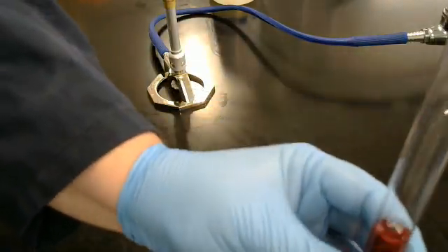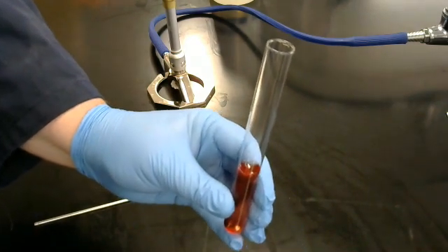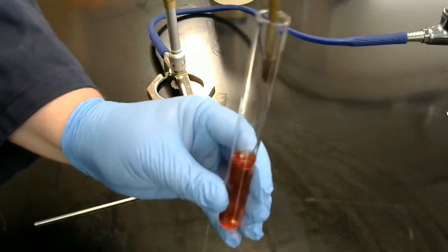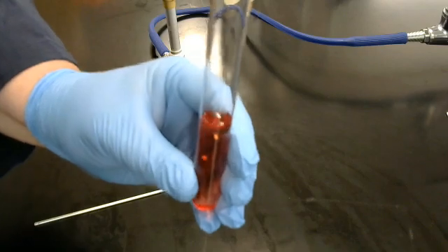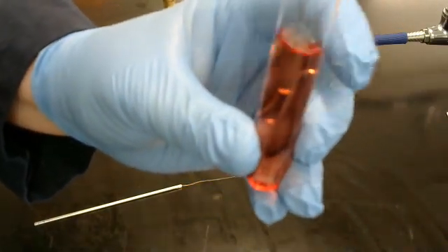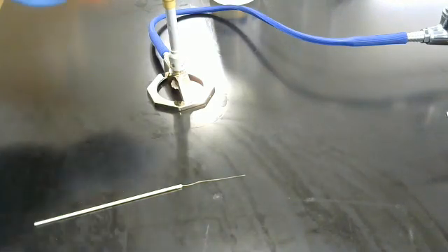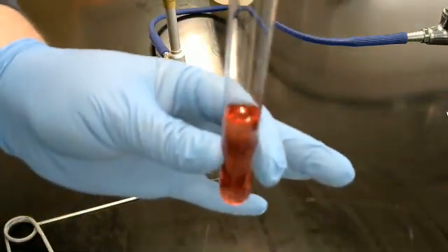We are going to use this. And I am going to go down and shake. And you can see bacteria inside of there. Right in the fire. Cap.